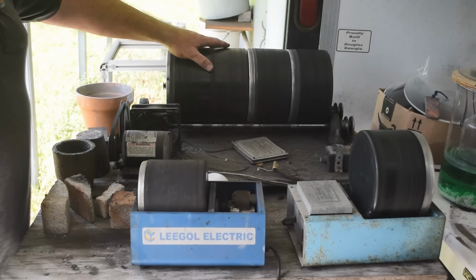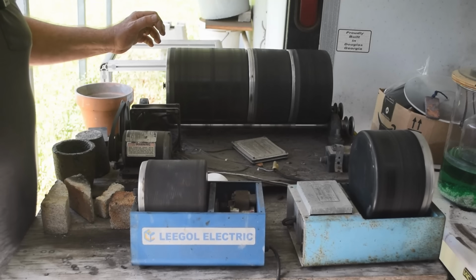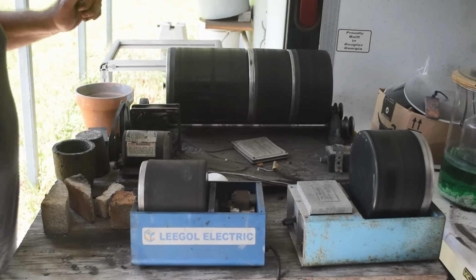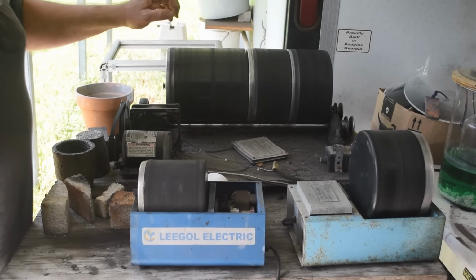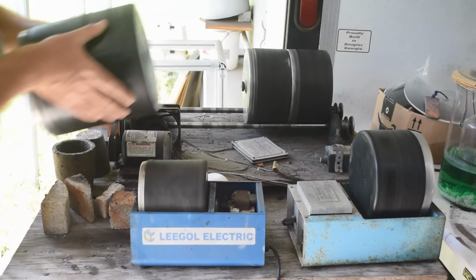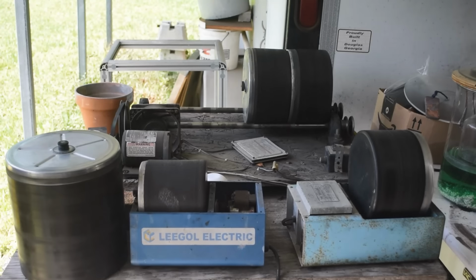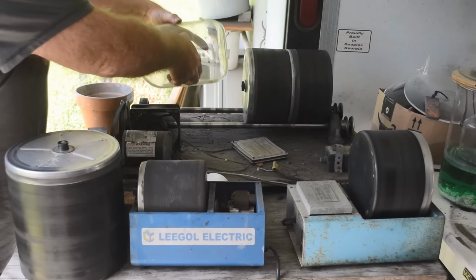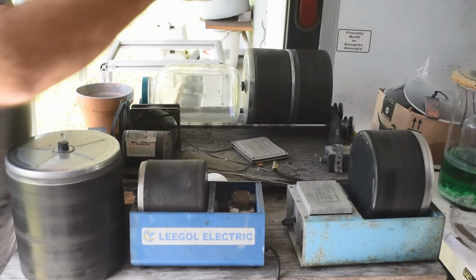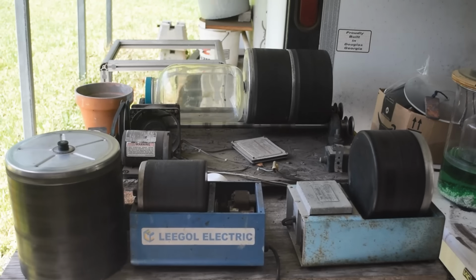Now, my rubber rock tumblers, these are made of rubber, are very expensive. These things cost a lot of money. I don't know what the chemicals will do to it. So I'm not going to do it in this. No. We're going to do it in a glass jar. And then I'm going to put it up here, just like that, and agitate it for a given amount of time. And we'll see how that does.